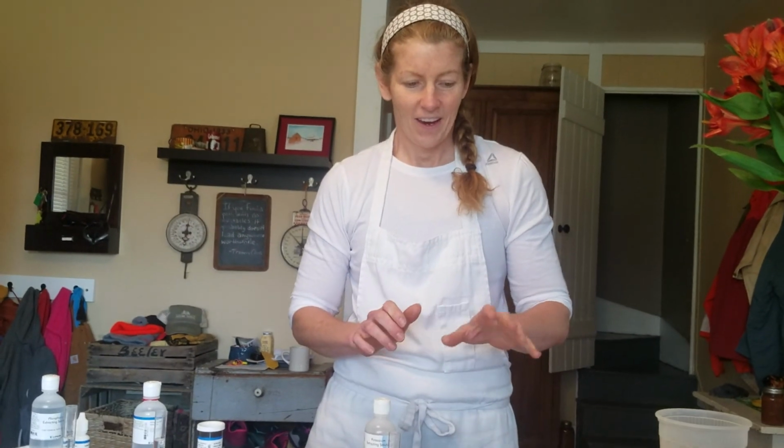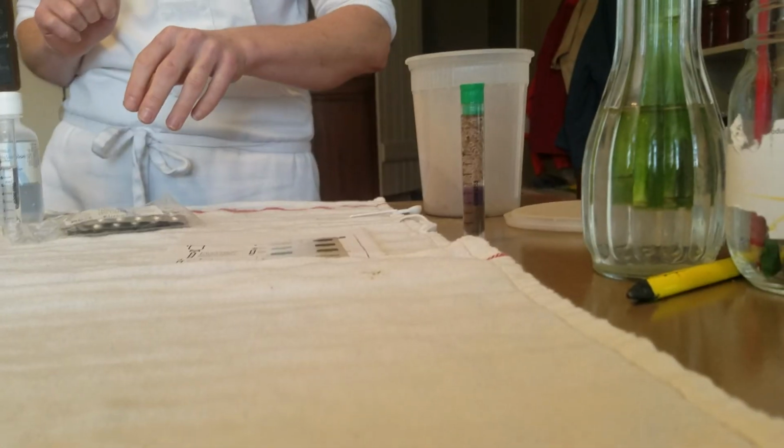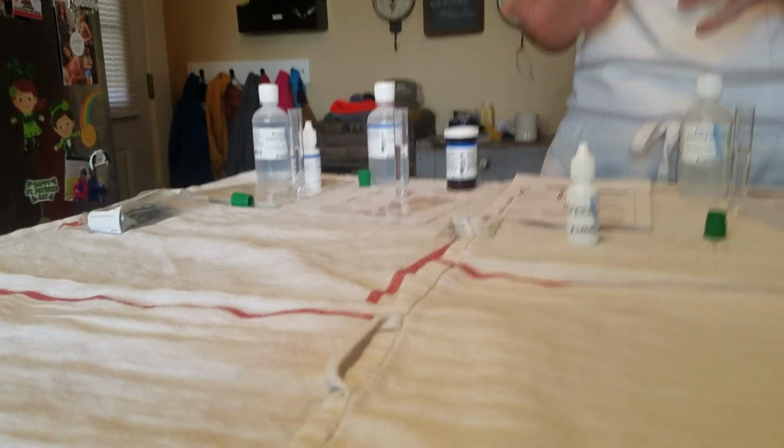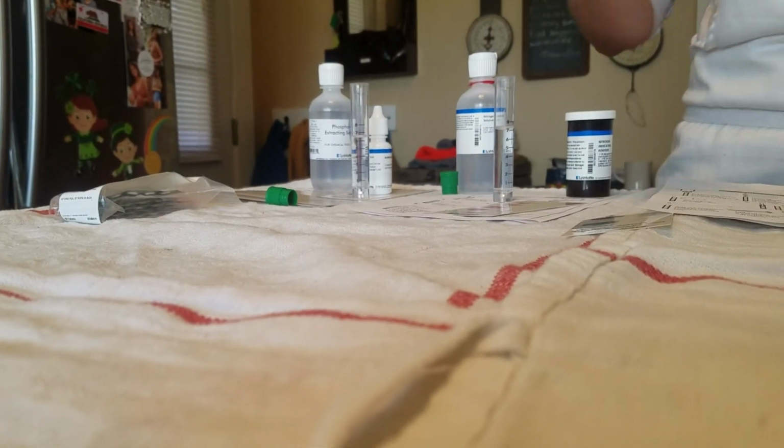Okay, so while we wait for our soil pH test to work out here, we're going to take a look over here at the rest of the tests we have for our soil today, which are all tests to measure the nutrient levels in the soil. So what we've got here are tests for potassium, nitrogen, and phosphorus, and those are called the macronutrients. Now, macro is Latin for large, so these are the nutrients needed in large amounts by plants.